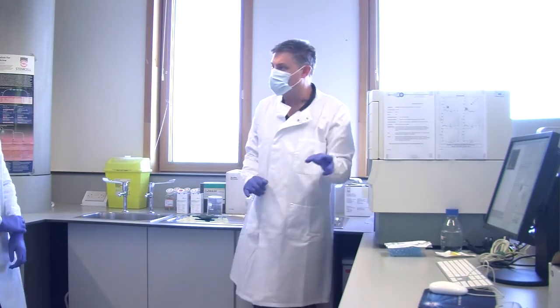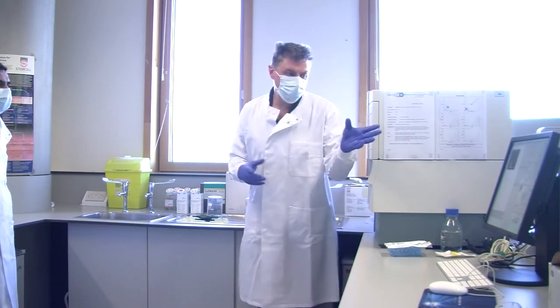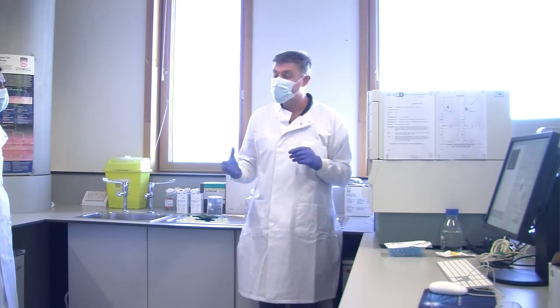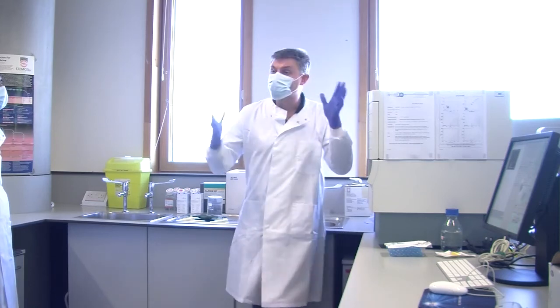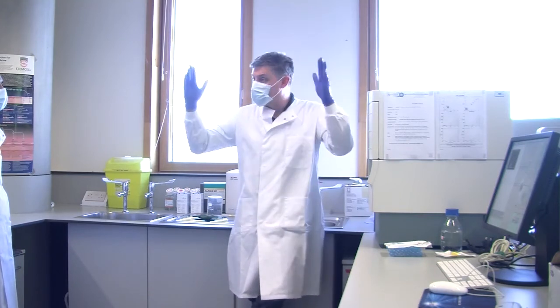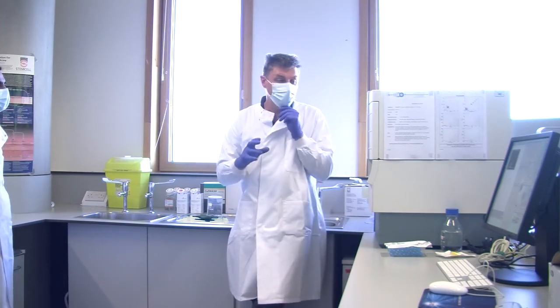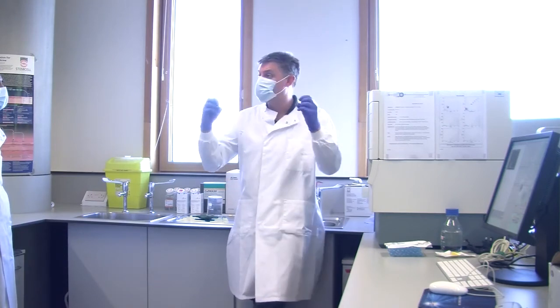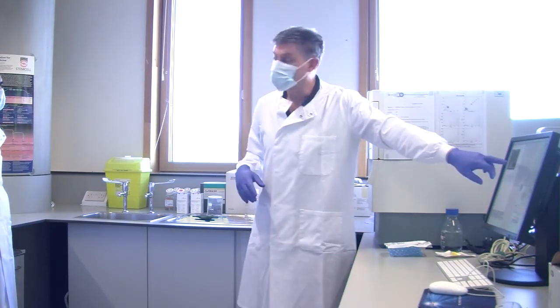So each one of these dots is an individual event. This is just a tube of water. What we're seeing here are tiny flakes of plastic, maybe from the tube. It could be tiny bits of dust that have settled in there. It could be micro bubbles, because when you squeeze the sheath and the sample fluid to get them into that narrow channel, you apply pressure to them. And if you have water that has air dissolved in it, as you pressurise it, that air starts to come out as bubbles. They're only tiny, they might be a micron across, but they will still trigger the laser.